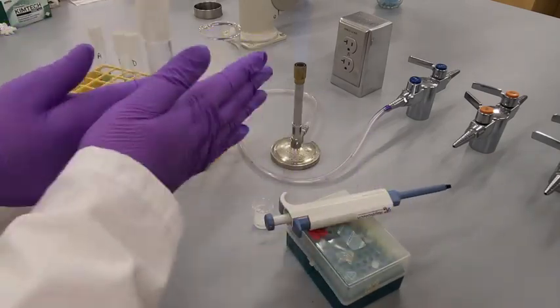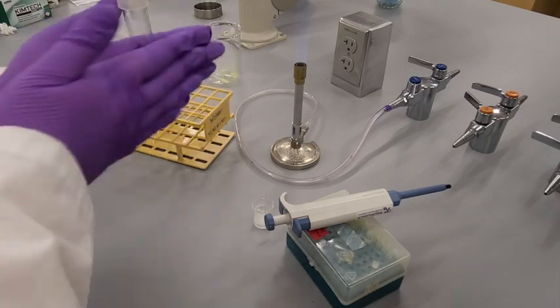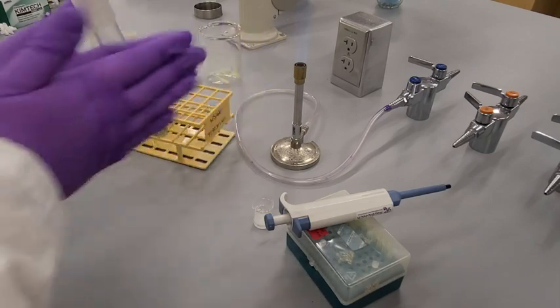And then what I'm going to do while the media is still warm and the agar hasn't solidified yet, I'm going to mix the saliva throughout it.